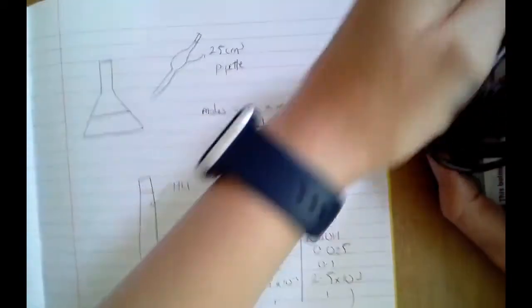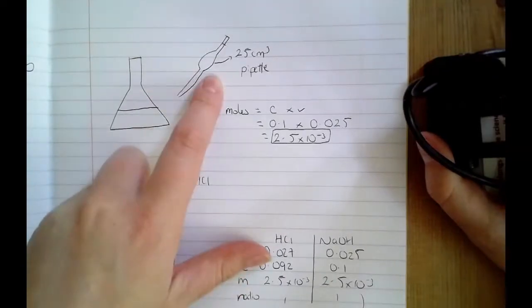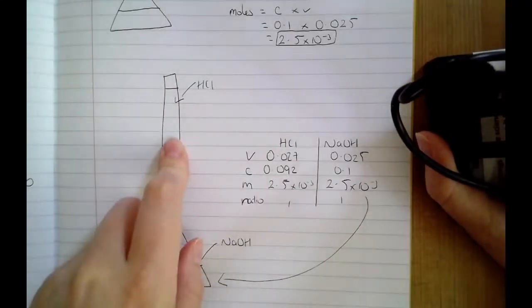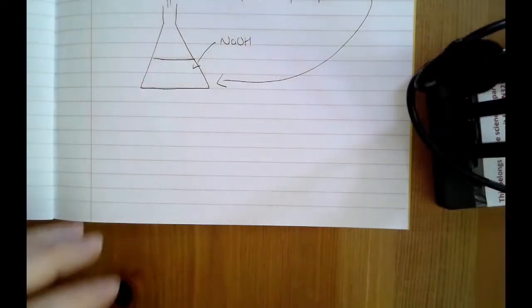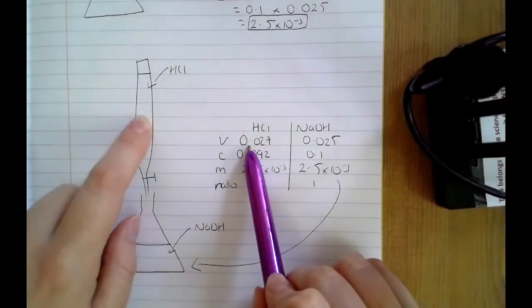In terms of whatever you're adding to the conical flask, you have to use a pipette. Using a beaker or a graduated cylinder, that's not accurate enough. And then obviously you've got your burette. So, just basic questions on glassware and knowing the pieces of glassware to use. They can also ask you a few questions about the titre itself. So when I'm talking about the titre, I'm talking about the volume that you've added from your burette.